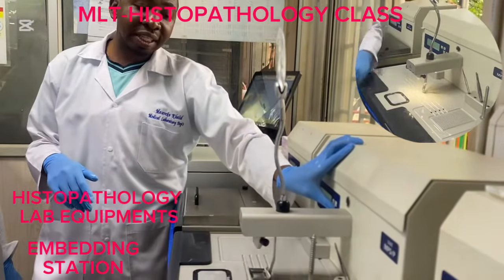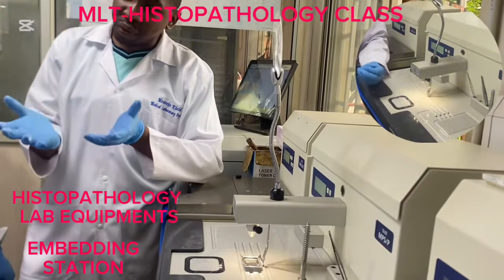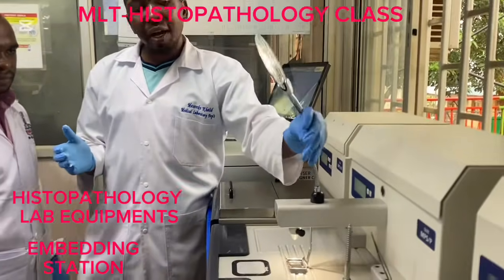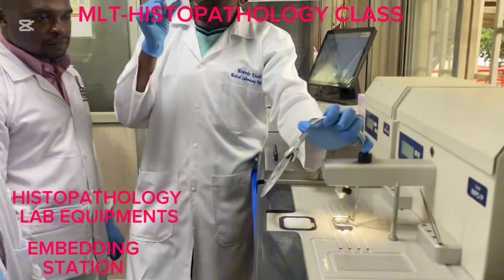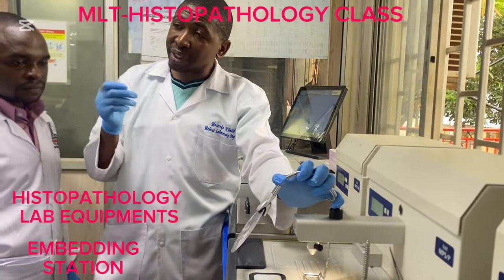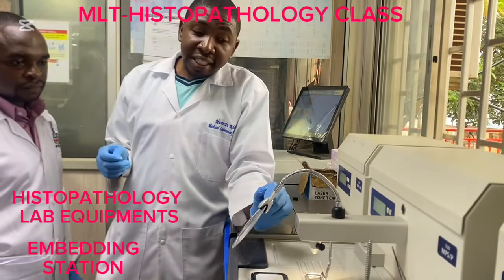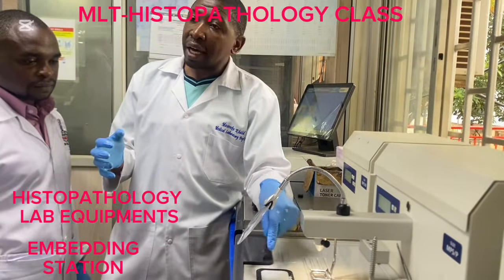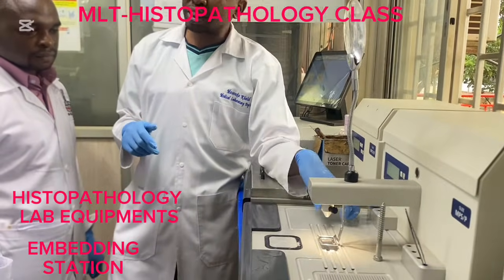Then we have the lighting system, illuminated working system. So you have tissues that are very tiny that requires proper observation, and it is accompanied with magnifying lens. So we have smaller pieces of tissue, for example endoscopic biopsies, needle biopsies, and curettings. They are very small. This one will help magnify, okay, increase the size so that we can carry out tissue orientation.